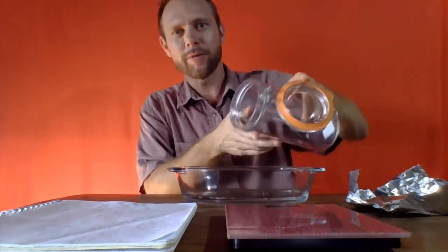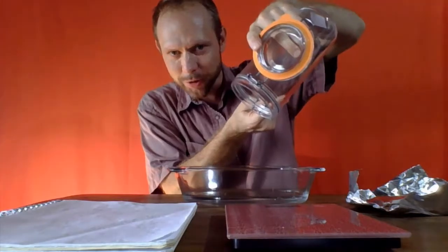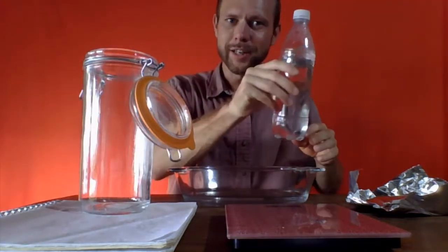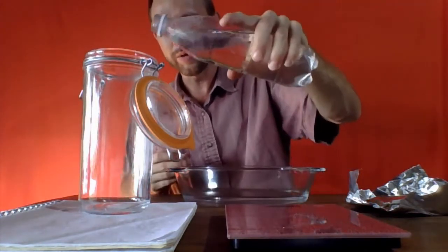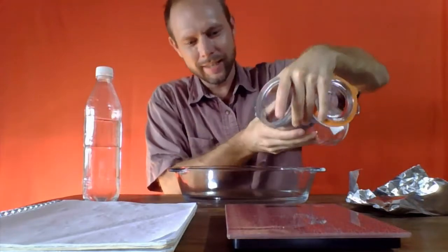And the thing with separations, we don't want to lose anything along the way, is there's still a little bit of salt water. I can see even there's a drop down there. We'll get that last drop, right? But we still didn't get it all. I have here just some plain distilled water, and I'm going to put a little water into this, and we're going to rinse it out.